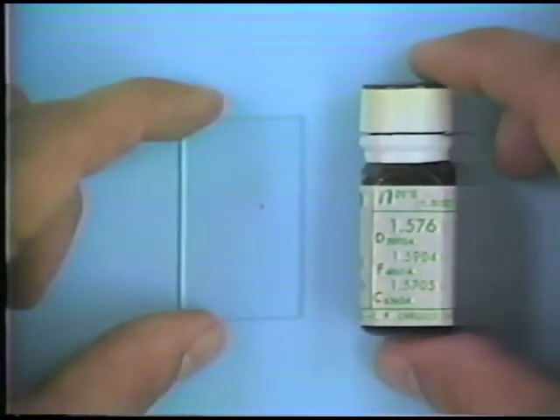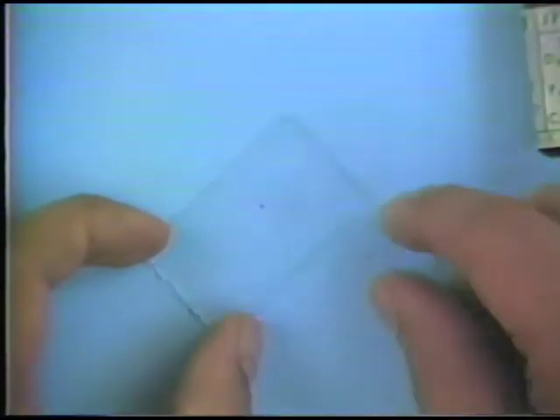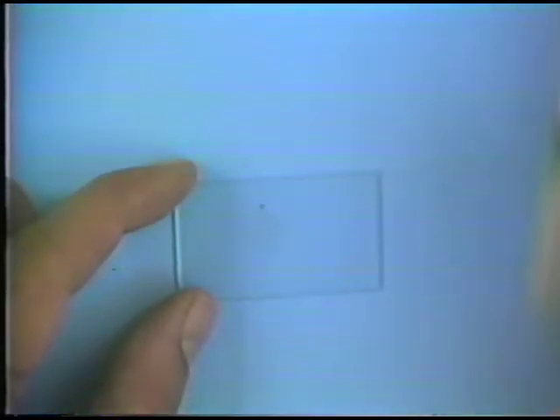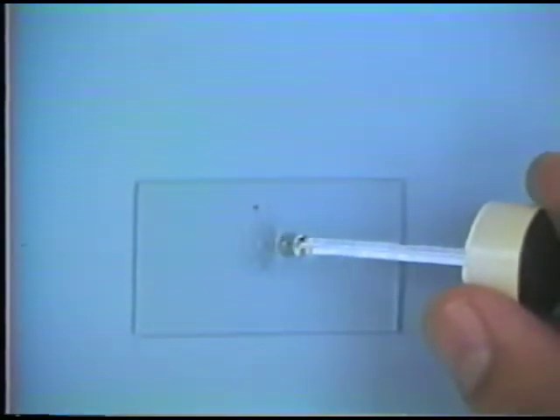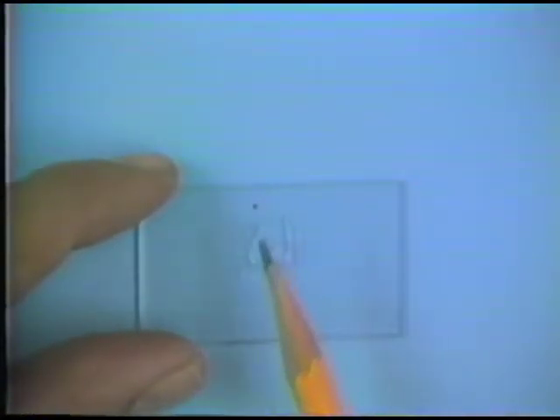And then I'm going to bathe these mineral grains located in this part of the slide with the immersion liquid. Before I do that, I'm going to place the cover glass over the top of these mineral grains. And so now I have mineral grains covered with the cover glass, and mostly there's open space between the cover glass and the glass slide. And I'm just now opening the immersion liquid, and I just touch the edge of the gap with the immersion liquid, and it begins to bathe the grains that are located between the cover glass and the glass slide. So now I've prepared an immersion mount, and most of these mineral grains are completely bathed in an immersion liquid.